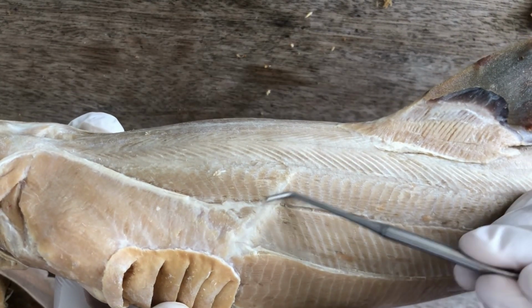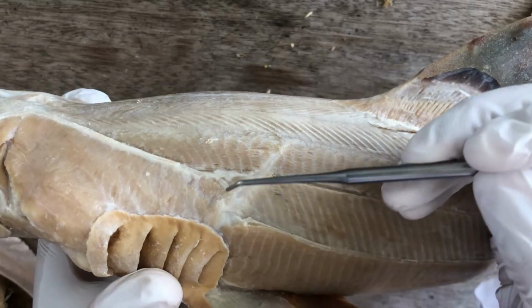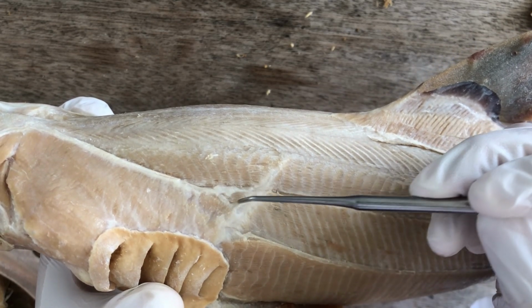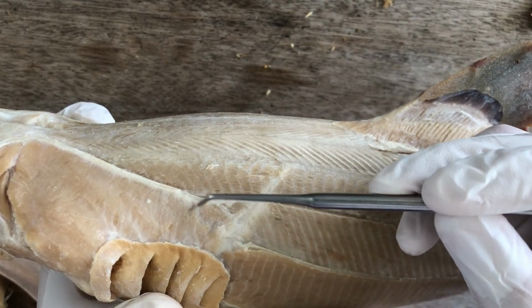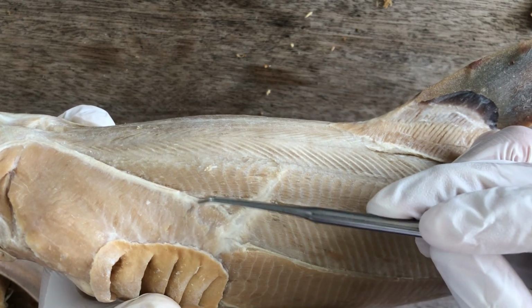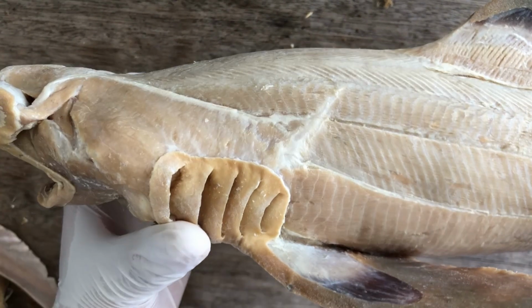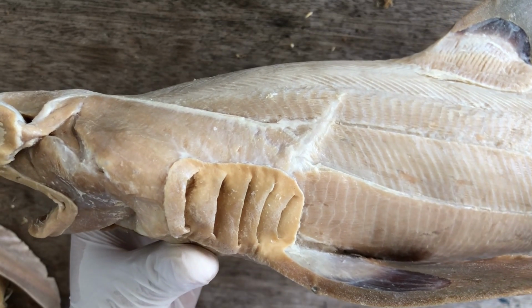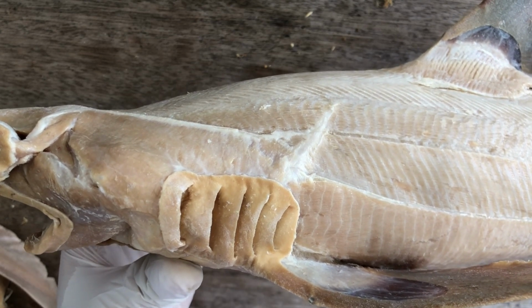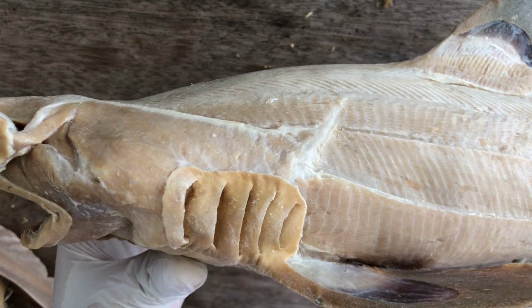is the scapular process. And as I was saying, the levators 3 to 6 are fused into a single muscle here near the scapular process. The triangular muscle peeking out from the dorsal branchial constrictors is the cucullaris muscle. And actually that's it for the branchiomeric musculature. In general, the levator muscles serve to elevate the gill arches, and they are associated with the inspiratory phase of respiration, allowing the shark to draw water into its oropharyngeal cavity.